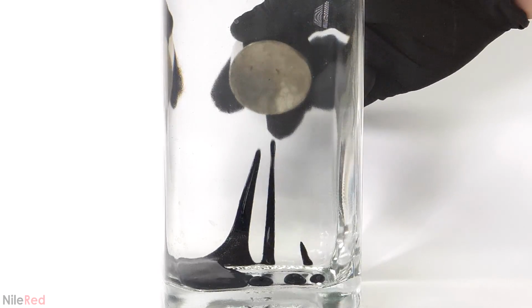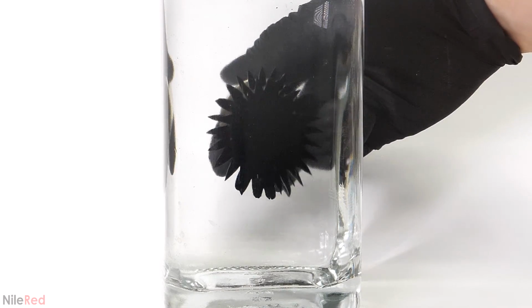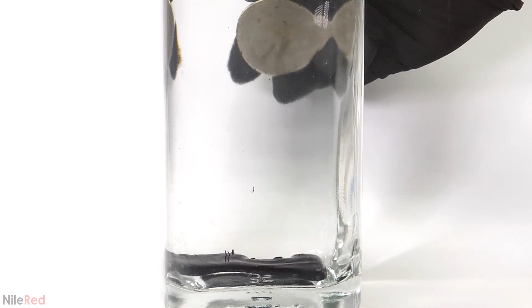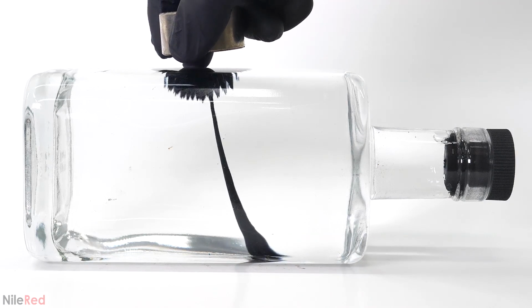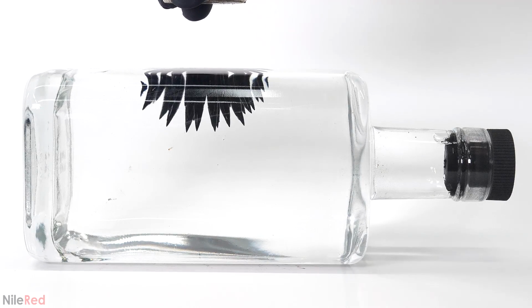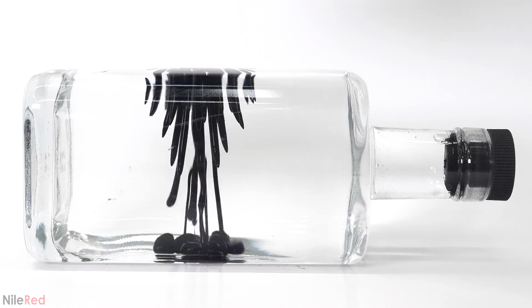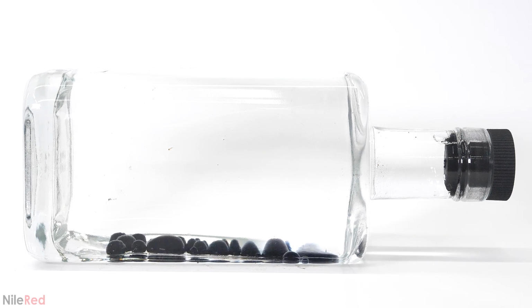For comparison though, this was another bottle that I made using that other batch that spiked really well, and you can see how much cleaner it is. It's just way smoother without all those bubbles, and it also spikes a lot more strongly. I'm really not sure why this batch turned out to be a lot more bubbly, but it must have had something to do with the surfactant. The preparation for both of them though were exactly the same, so I'm not really sure why there would be such a difference.